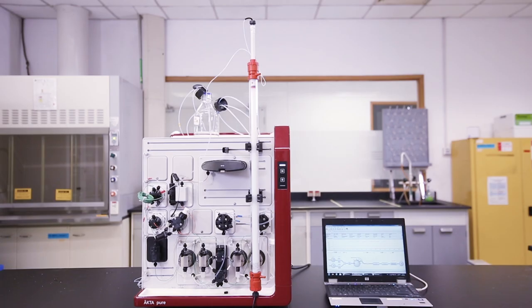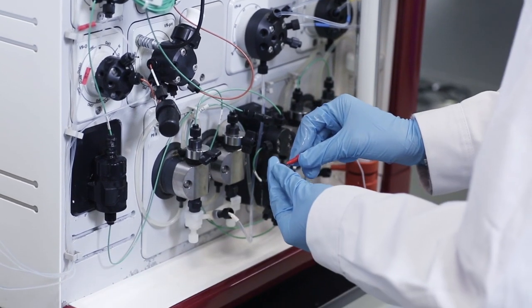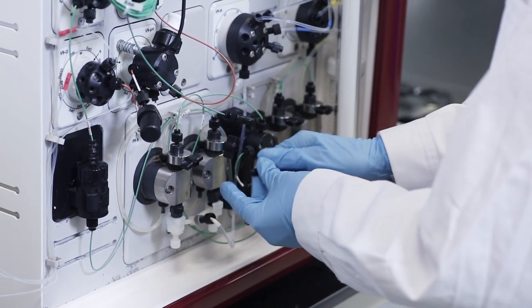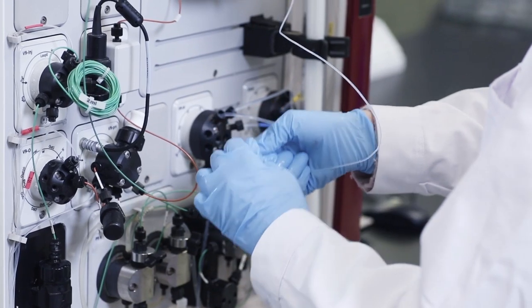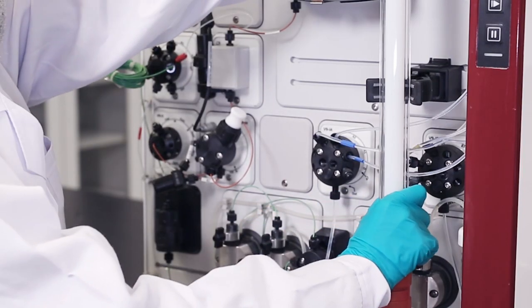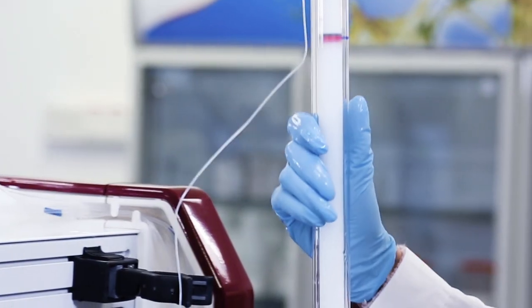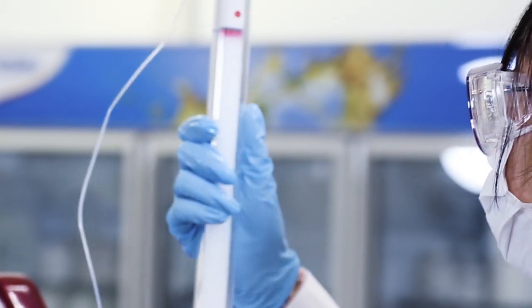Your column is now packed. If you are not using the column right now, remove the connection to the pump, screw stop plugs into both the top and bottom end of the column. Inspect for any channel or gap and your packed column is ready to use.